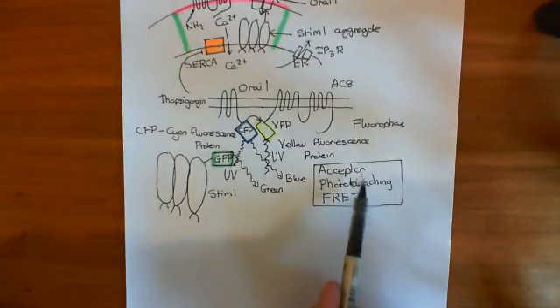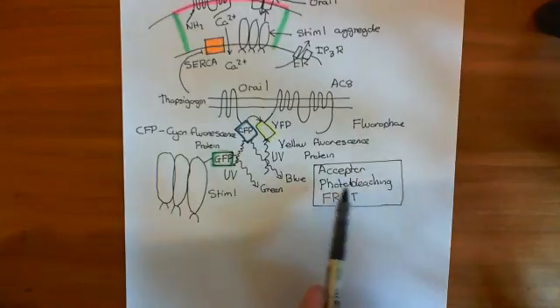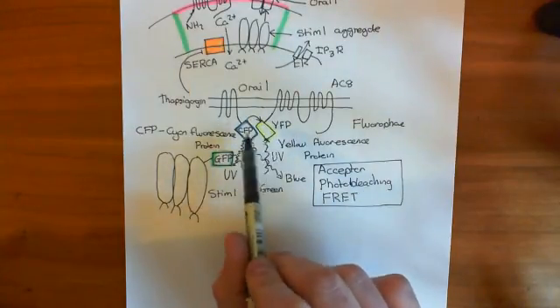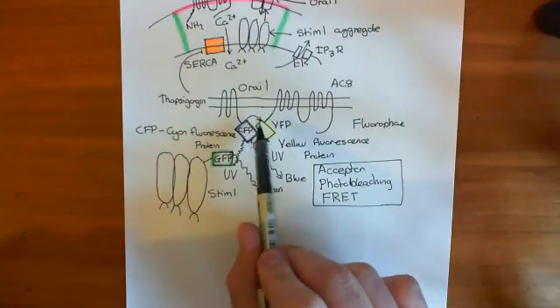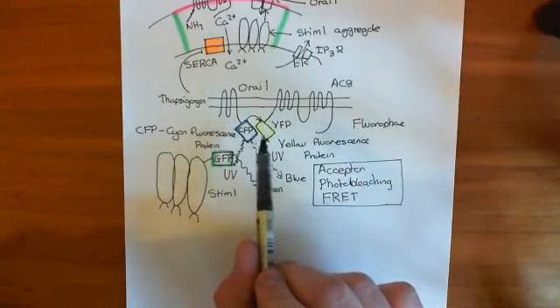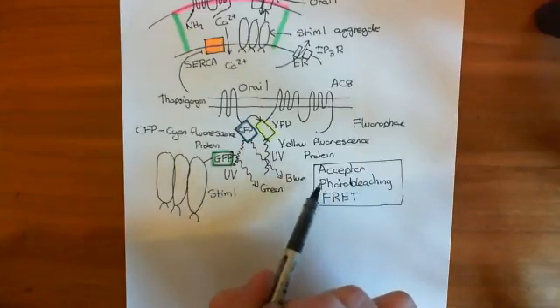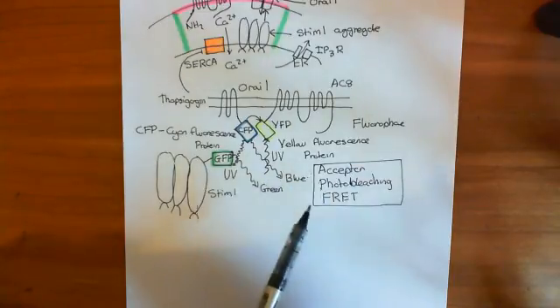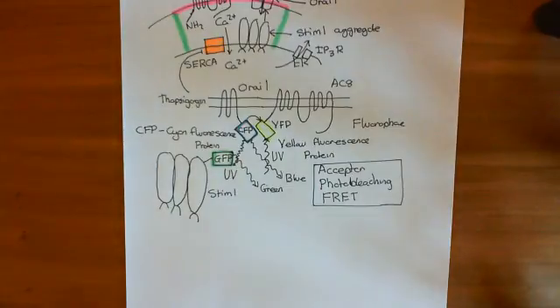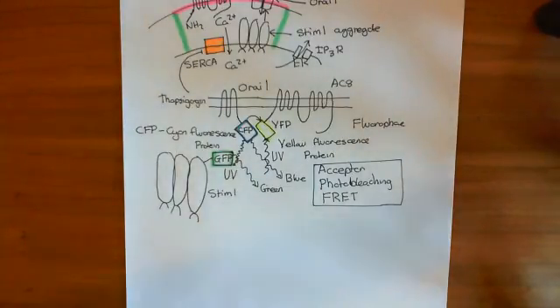The reason it's called acceptor photo-bleaching is that you are photo-bleaching the acceptor of energy. Yellow fluorescence protein usually accepts energy from cyan fluorescence protein, so what you destroy — you photo-bleach — is that energy acceptor. That's why it's called acceptor photo-bleaching FRET, and it seeks to confirm the results of normal FRET.